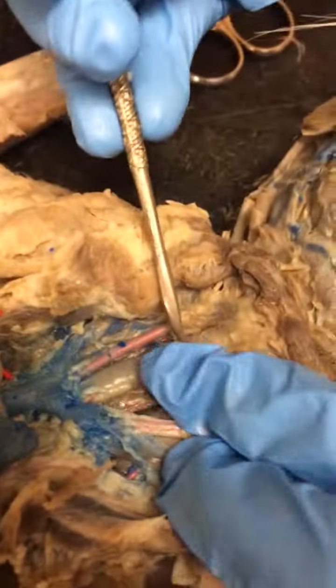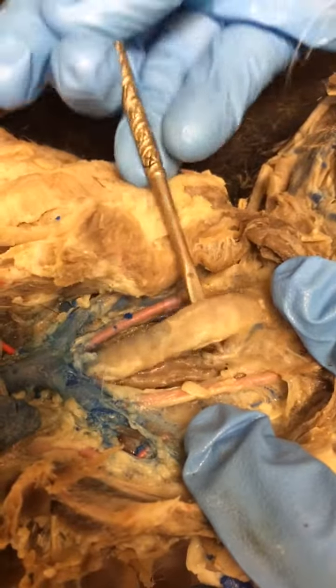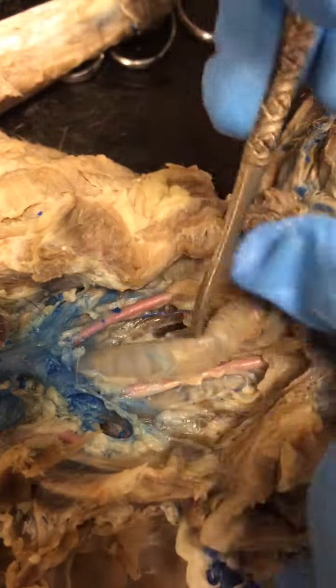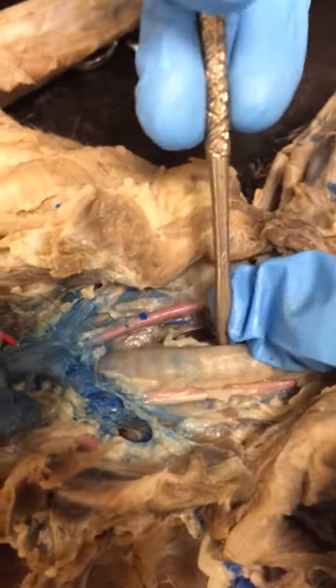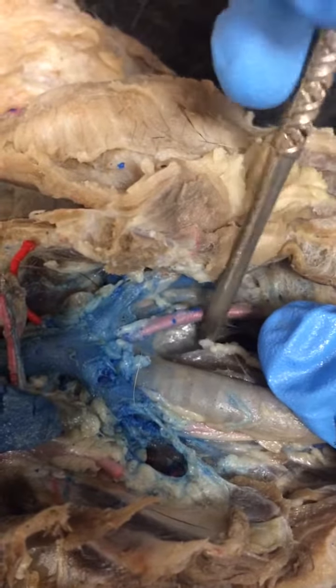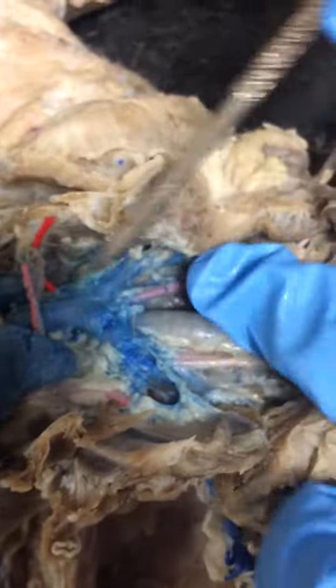Is there anything that I'm missing that we need to identify that y'all can think of off the top of your heads? The trachea. Yeah, so, okay, sorry. Up here is your trachea. This is pretty much the only place you can really see it. It looks like this. It's a thin, really not colored tube. Below that, deep to that, somewhere in there is your esophagus. We can't really see it well, but it's in there somewhere. I'm just bad at identifying it.